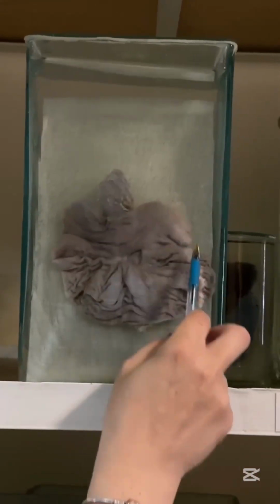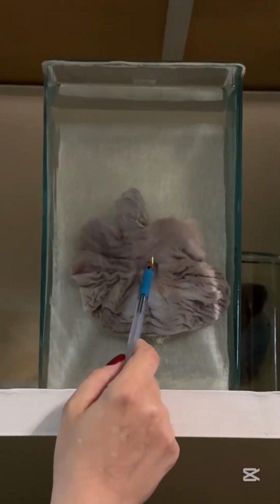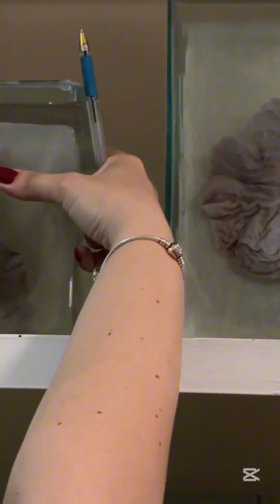Interesting. In this one, you see the stomach, it is opened. Behind is the pancreas. Again, you should rotate to normal position. It is not the esophagus, that is the pancreas. In the middle, you see a large chronic ulceration, peptic ulcer, and the complication of peptic ulcer is penetration to the pancreas. Penetration.